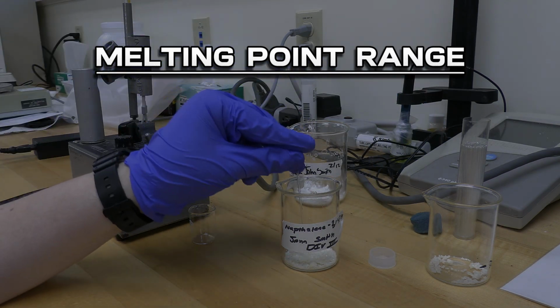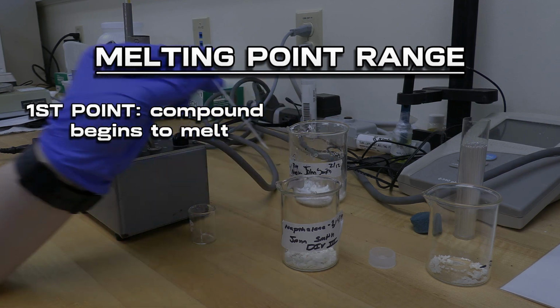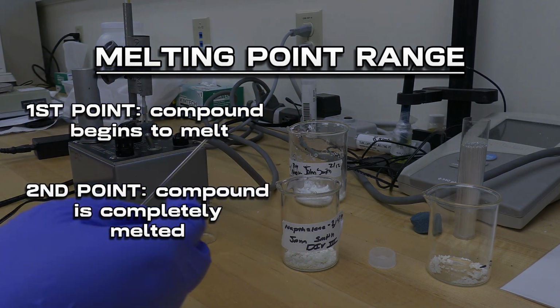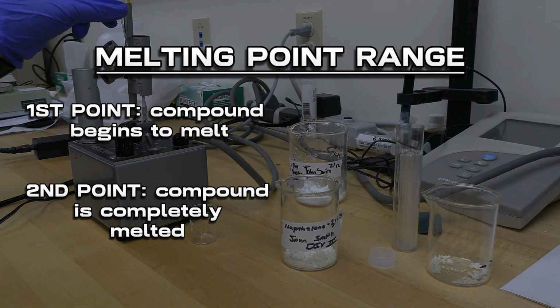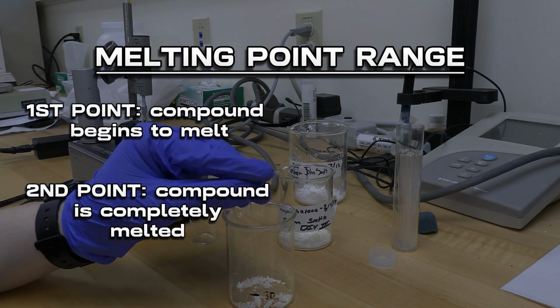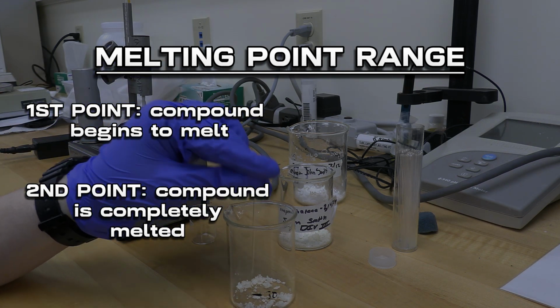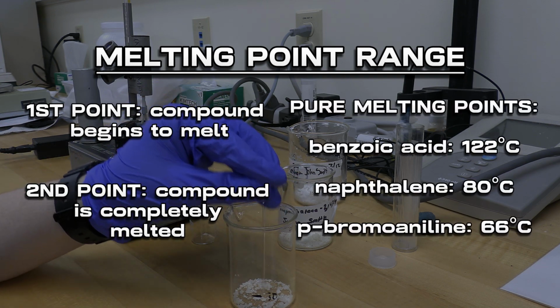The first melting point temperature is when the compound inside of the tube first begins to melt, and the second temperature is when the compound is completely melted. From left to right, these tubes contain benzoic acid, naphthalene, and p-bromoaniline. These happen to be known compounds, and according to the literature, the melting points of these pure compounds are respectively 122 degrees Celsius, 80 degrees Celsius, and 66 degrees Celsius.